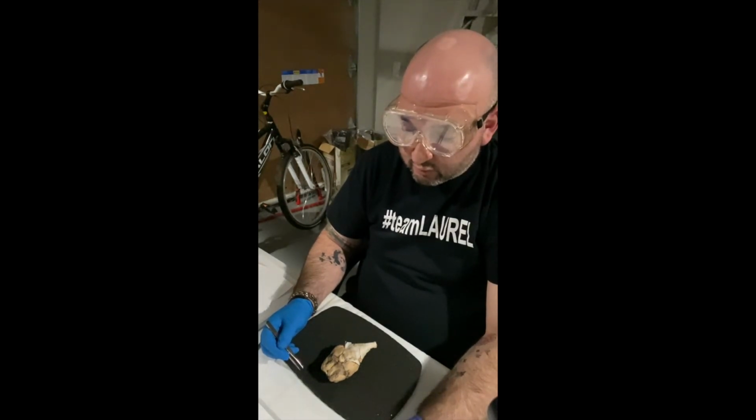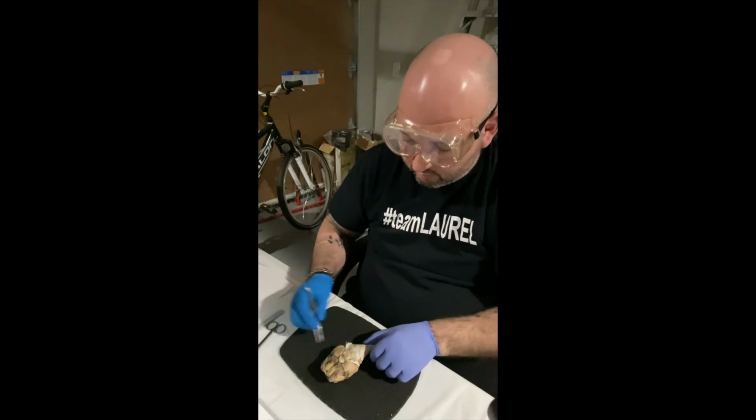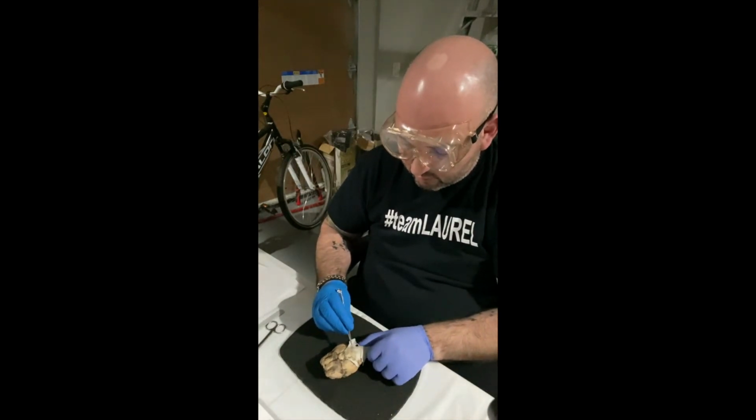So I'm going to remove these from the brain. So I'm just going to pull gently here.